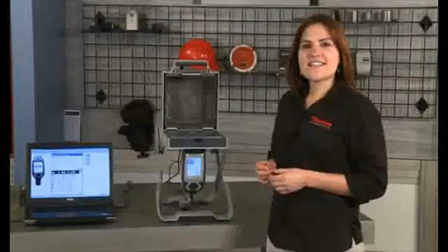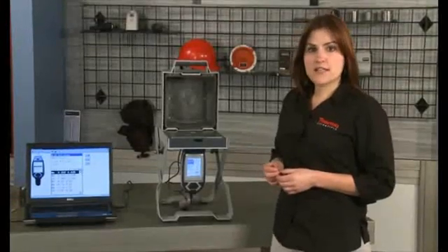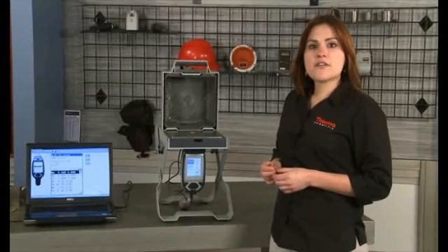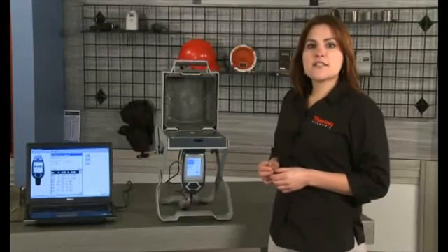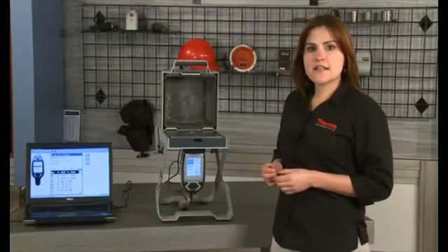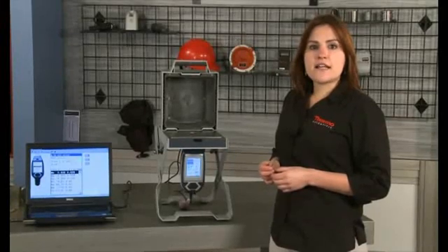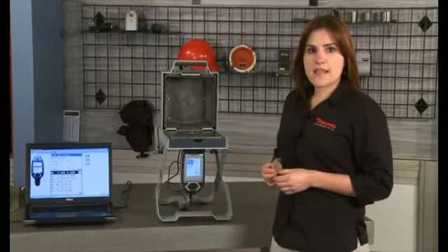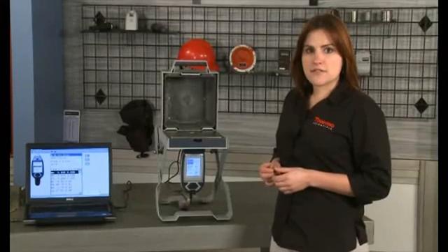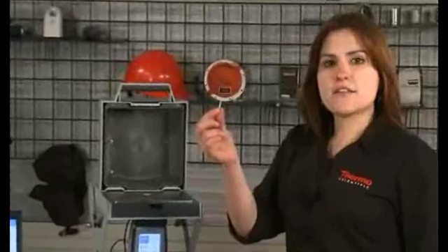The Thermo Scientific Niton analyzer is smart enough to deal with almost every situation, but there will be a few examples of alloys that cannot be handled without interpreting the analyzer data based on knowledge of alloys. For this reason, we will measure several types, shapes, and sizes of alloys to demonstrate the use of the analyzer for this application. We will start with some tough examples. Here is a 2mm 316 stainless steel wire.